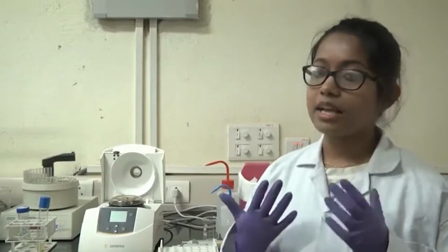So why do we need to isolate plasmid in a molecular biology lab? There are different experiments you can design with isolated plasmid. You can design any kind of PCR reaction, you can digest the plasmid, you can clone a particular gene inside the plasmid, and you can also do transfection and other procedures. Isolating a plasmid is a useful technique for a microbiology or molecular biology lab, and that is what we are going to do today.